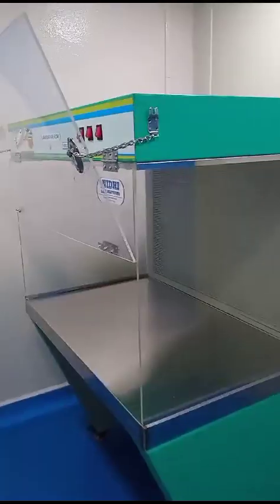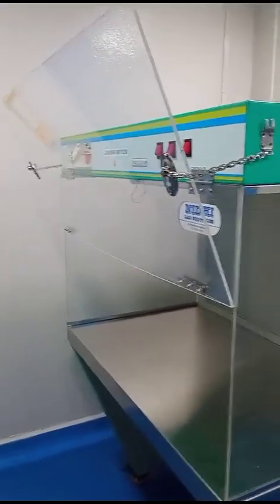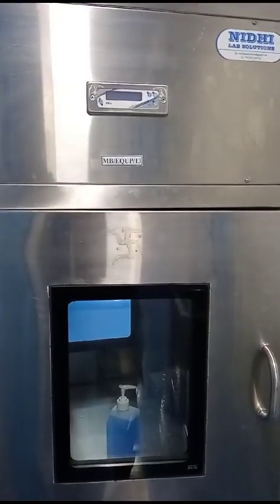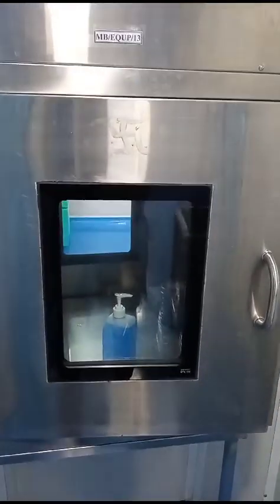This is the laminar airflow, where we test the food samples. After that, this is the dynamic pass box, which is opened one time from one side only. After that we have a trolley, and now move to the exit section, that is airlock 3.